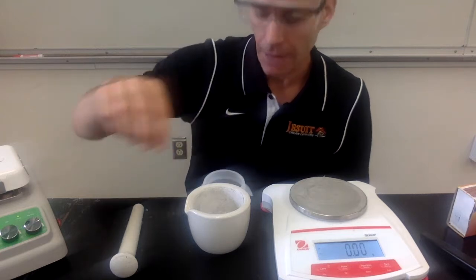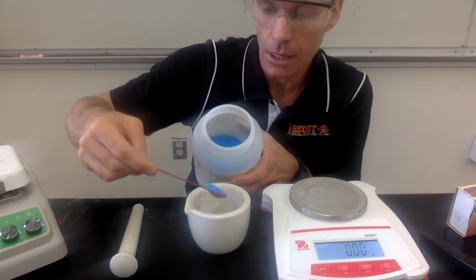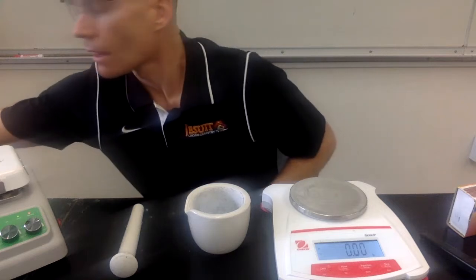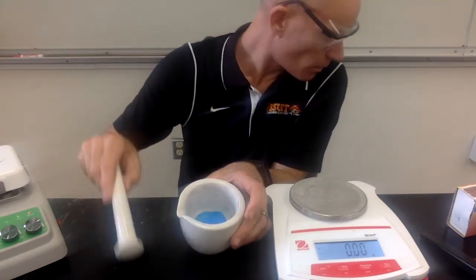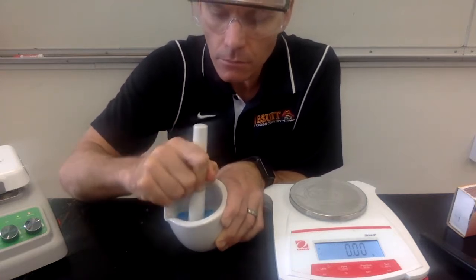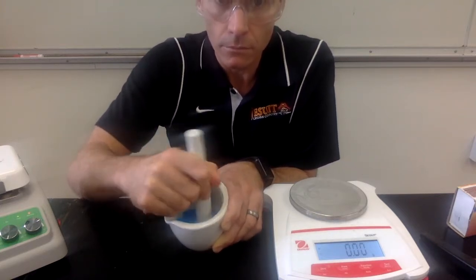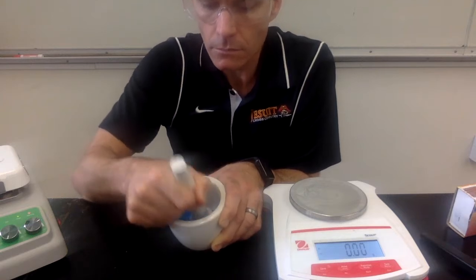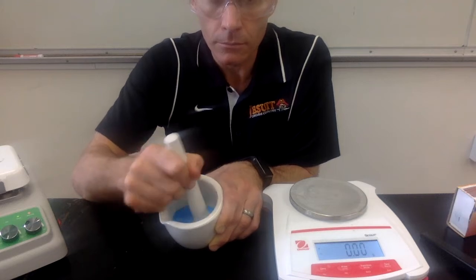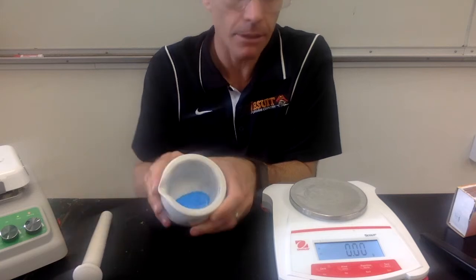This is investigation number 5. We're going to be taking this blue crystal. So I'm taking this substance, which is like a blue crystal, and I'm putting it into the mortar. And we will be using the mortar, and you make your observations. Okay, so you can make your observations on that step.